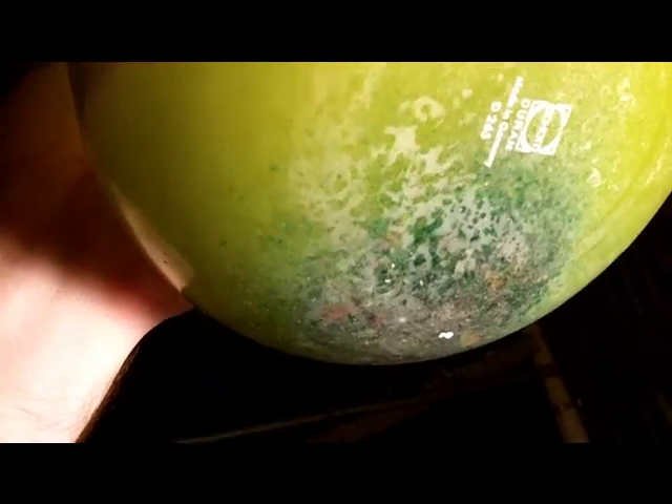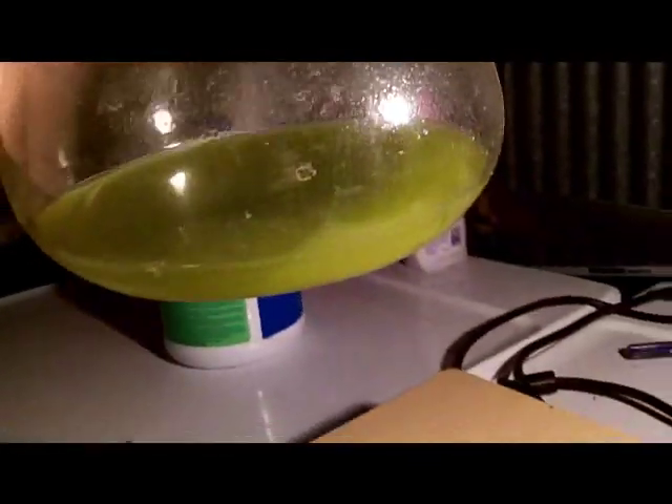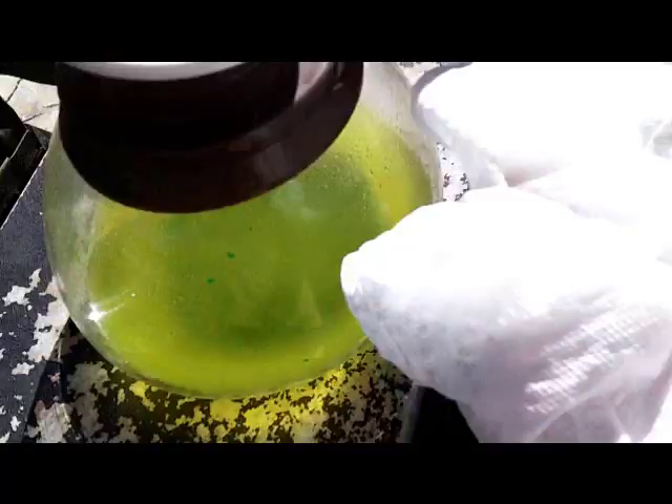This has been sitting for just a few hours. I actually added a little bit more HCl and Clorox to give it a little bit more volume. There are just maybe a few little flakes of gold floating around in there still, but mostly it's just the paint and little plastic fragments that got caught up in there. I'll let this sit overnight, stir it around a little bit more in the morning, then filter it off and I'll have a nice clean gold solution. There's a little bit of a green tint, which indicates probably the presence of a little bit of copper left — that's to be expected. That's what the last steps for refining are going to handle.